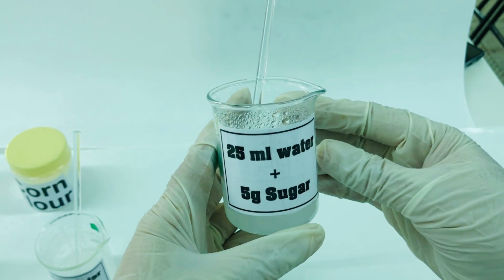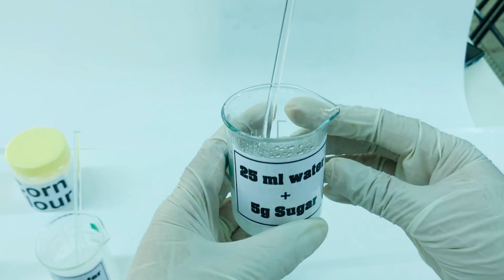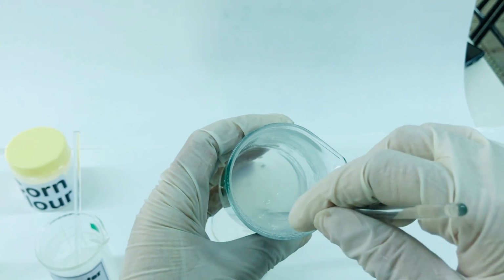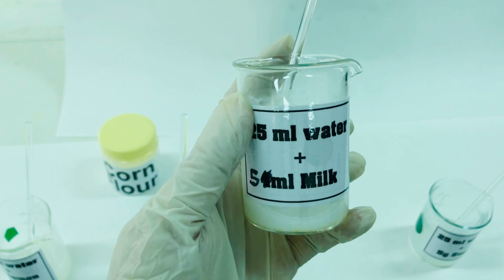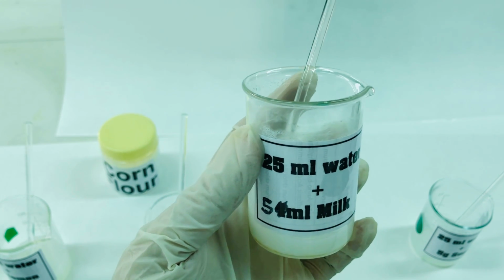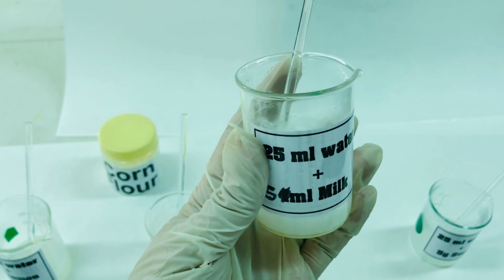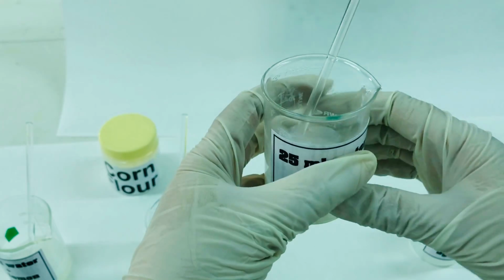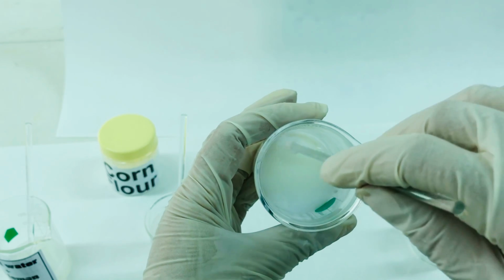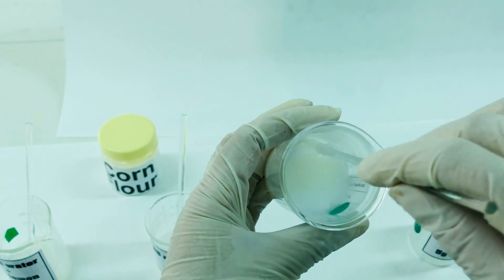In this case, what we have added is 5 grams of sugar, and what is observed is that the process of gelatinization slows down on addition of sugar. Another factor that affects the process of gelatinization is addition of protein. Here we have taken milk sample as the source of protein. However, the effect of protein is unpredictable. In this case, we can see formation of a smooth gel due to addition of milk.